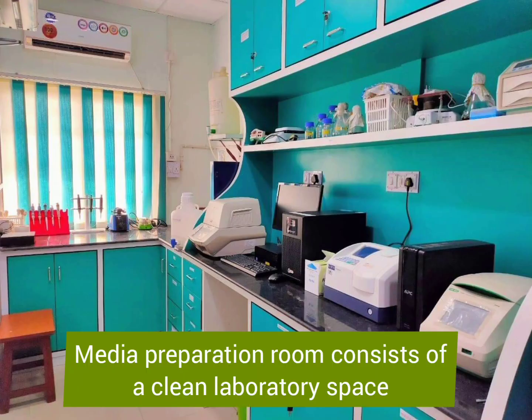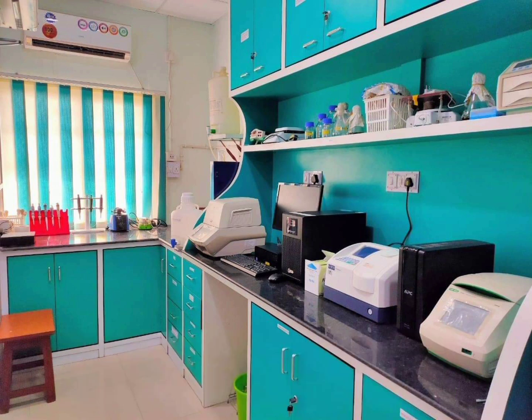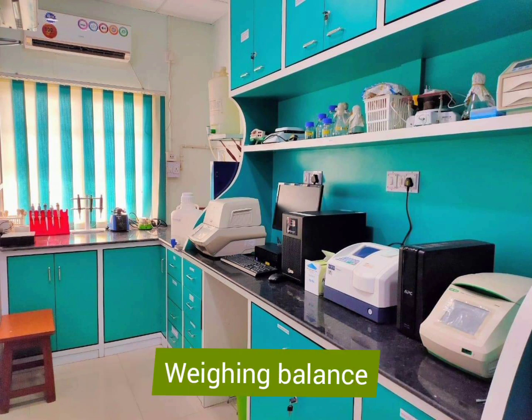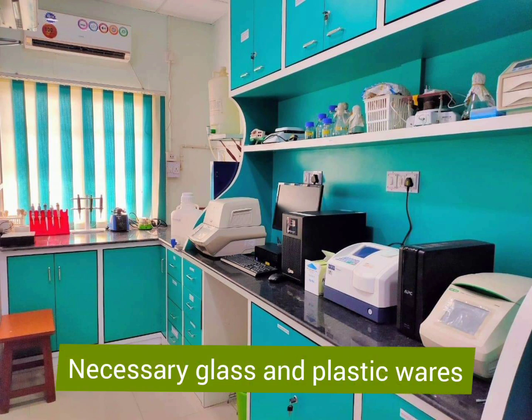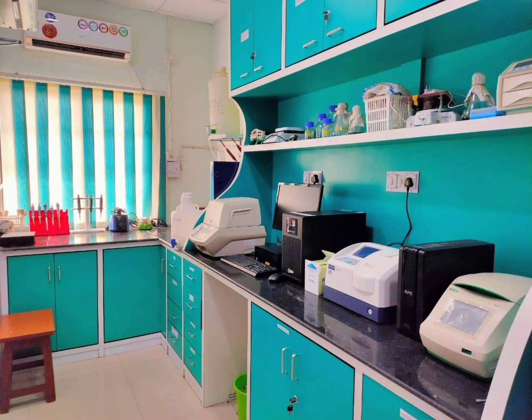A media preparation room typically consists of a clean laboratory space where the culture media are prepared and sterilized. The room contains a working bench, weighing balance, refrigerator, necessary glass and plastic wares, micro pipettes, and required media components, among others.